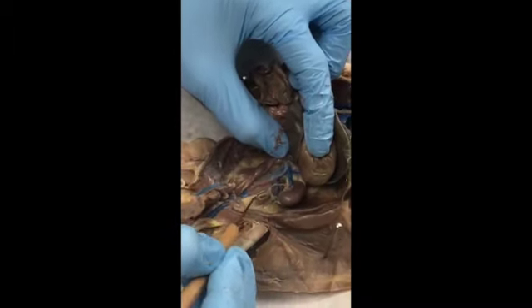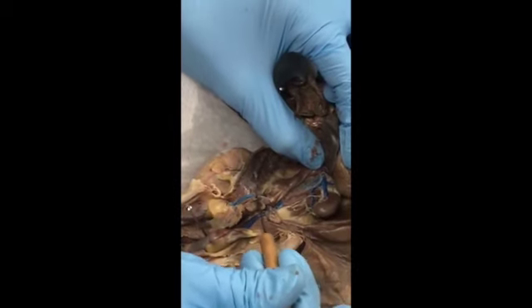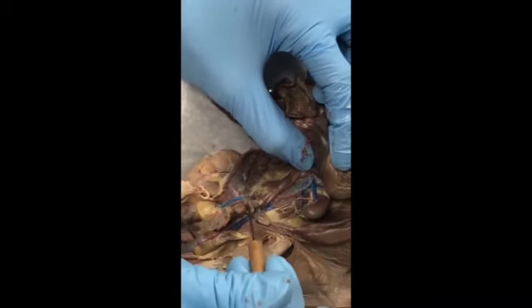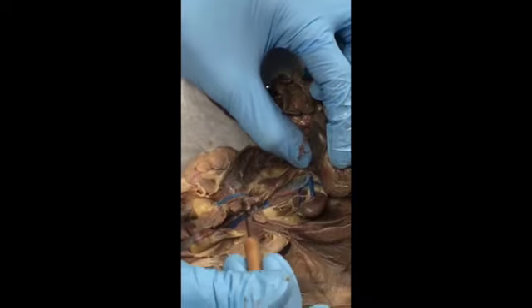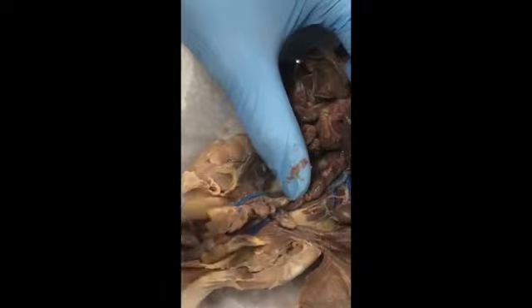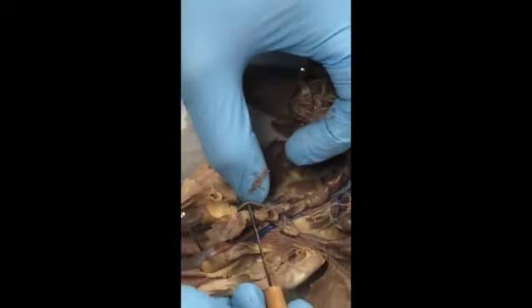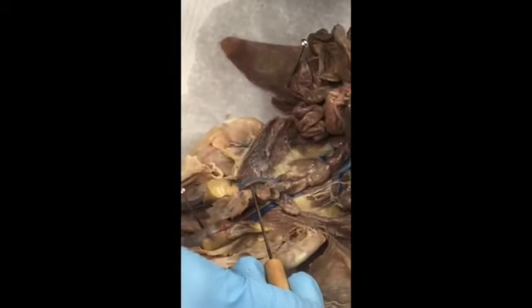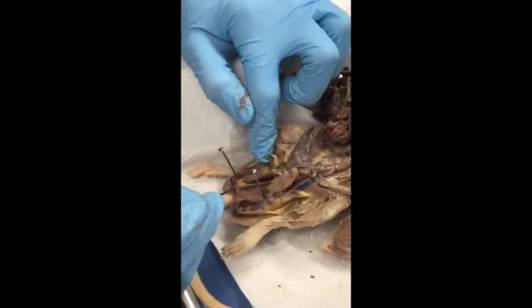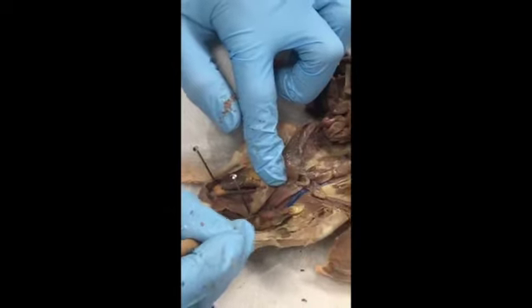This is your ureter. Runs down to the bladder here. This that's flat would push up against it if it was full. This is your prostate gland right here in front, always in front of the bladder. These are your seminal vesicles here. And then this tube right there, not the blue, but this one, is the vas deferens, which runs down and connects to the bottom of the testes here. And you should have one on the other side too, right here. Vas deferens connects to the testes.